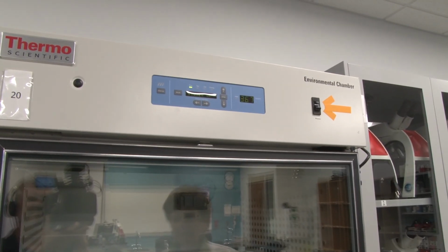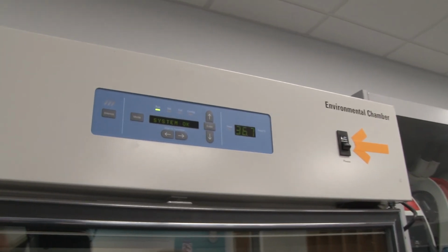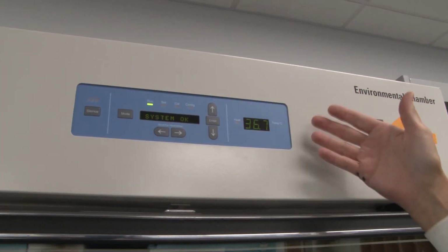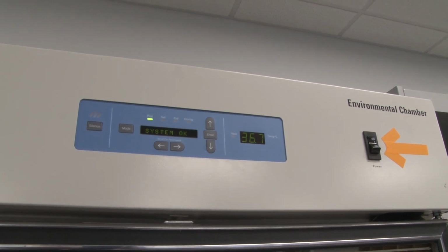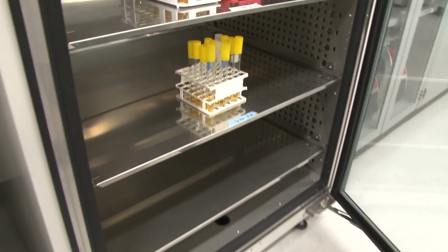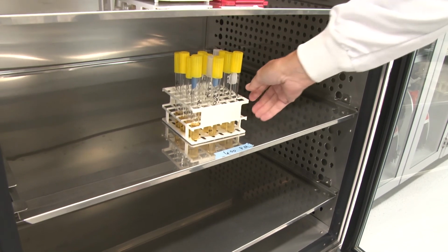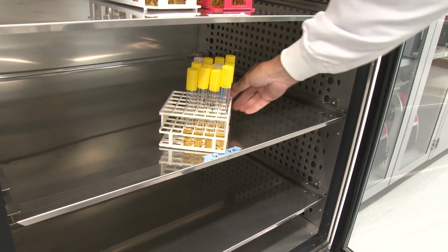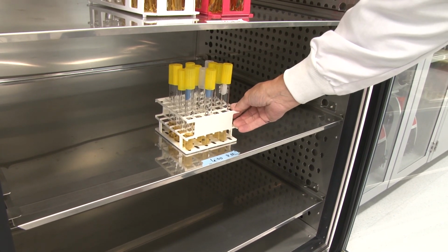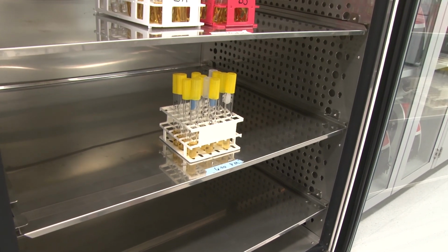So here we are back at the incubator. Let's just wrap up sessions 7 and 8, the setup. We've got our temperature set just about to 37 degrees, body temperature, so we're good to go. I've opened the door recently, so it's probably down a little bit. I'm going to open the door now, and I'm going to show you our setup. I just placed our boiling for sterilization tubes, the 0 through the 15 minutes of boiling, in this rack on the bottom shelf.